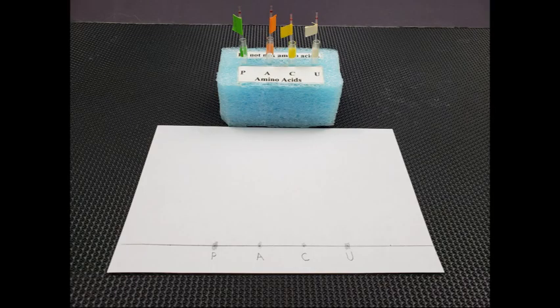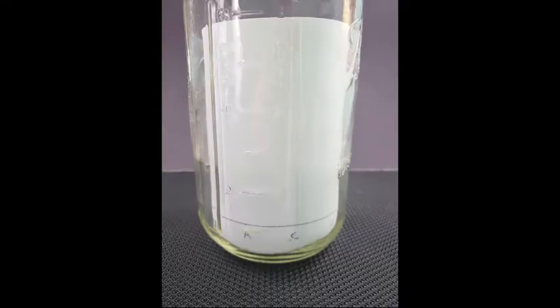Place the chromatography paper on a clean surface and place each amino acid solution over the appropriate dot. It's important that you apply each amino acid more than once to the paper in order to get enough amino acid solution deposited. Allow each application of the amino acid to dry over each dot before adding more. Then roll it to form a tube. You must ensure that your pencil line is visible.